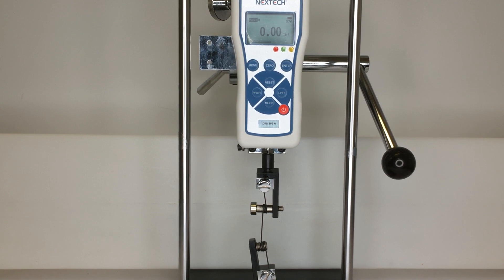Hello everyone, this is Dimitri from Dexmat. Today I will be showing you how to conduct a tensile strength test on carbon nanotube yarn.